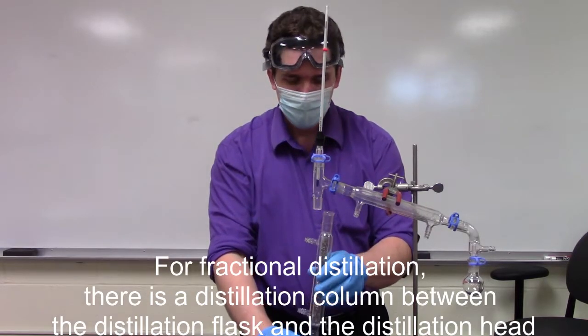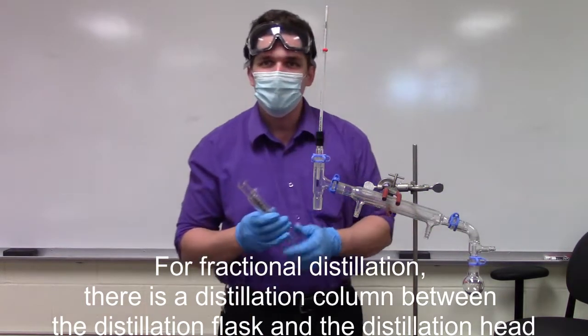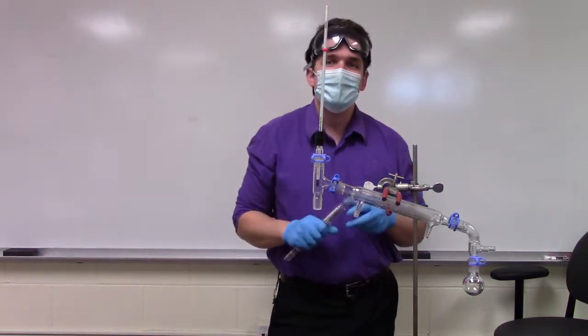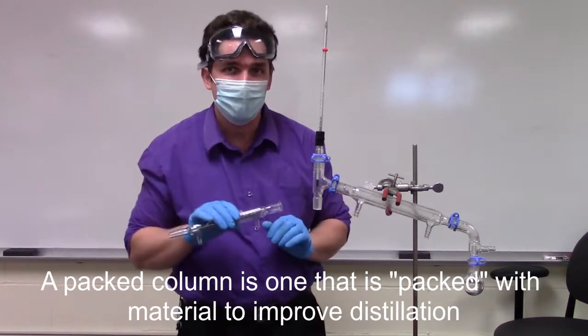Now, I'm a chemical engineer, I'm a purist, but I understand that chemists are not purists in this regard. There is a third type of distillation column which is referred to as a packed distillation column. Now, we're going to use this synonymously with fractional columns. Just keep in mind that if you do it with people outside the field of chemistry, they're not going to consider this a fractional column, they're going to consider this a packed column.